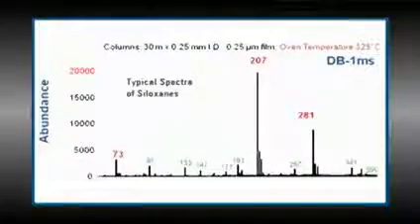In fact, some people have attributed these septa peaks to the column, since they typically see siloxanes if they have a mass spec. The key is that they are peaks. Remember, columns can't chromatograph themselves. They won't give peaks. If the column is bleeding, the background signal goes up because there isn't a point source for the bleed. The entire column bleeds. If you get a peak, something entered the chromatographic process and gave a peak. And that's how we know it's something outside of the column, and in this case, the septa. It bleeds and it collects on the front of the column when the column's cool, and then the peaks chromatograph when we go through a temperature program.